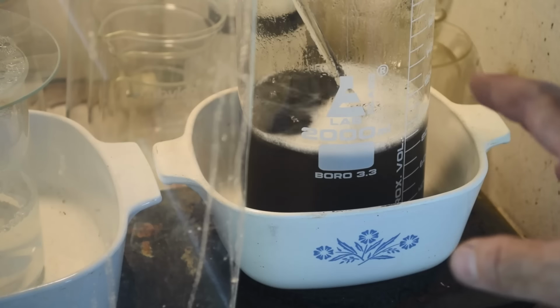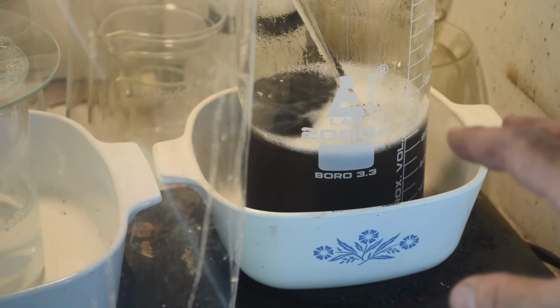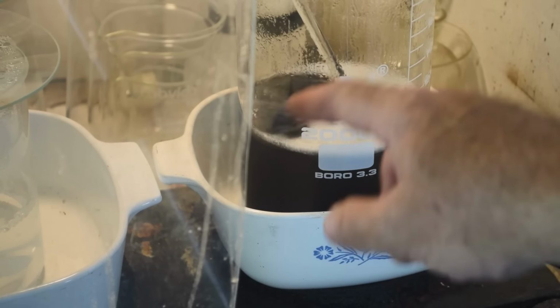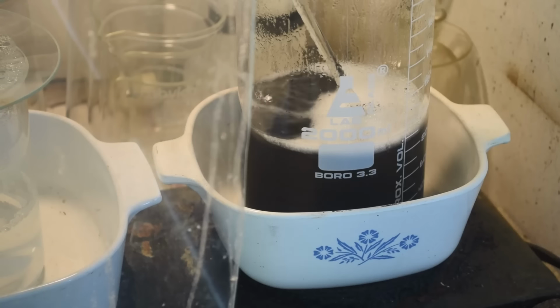Hard to tell in the fume hood down in the Corningware dish, but I'll pull it out and set it on a white cloth, and you'll be able to see through the liquid down to the bottom. And there's a pile of palladium metal down there. In fact, that's what this boiling is. It's acting like boiling stones down in the bottom of the beaker. So yeah, let me find a white cloth.